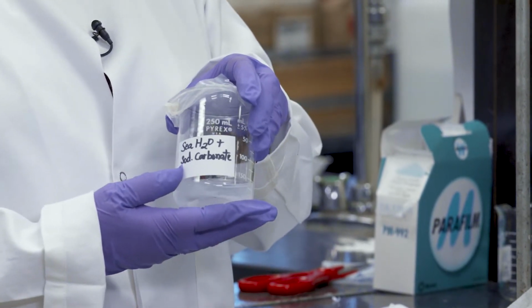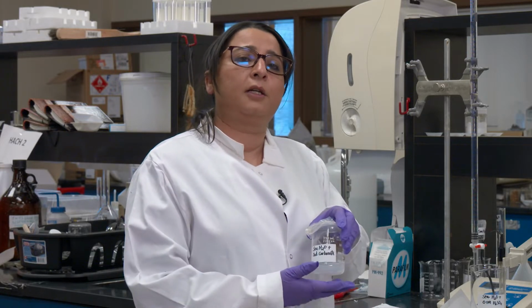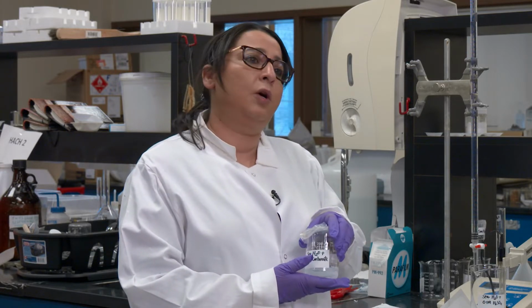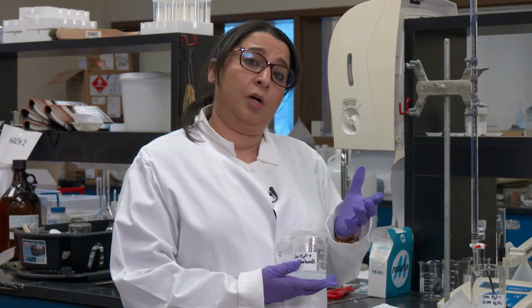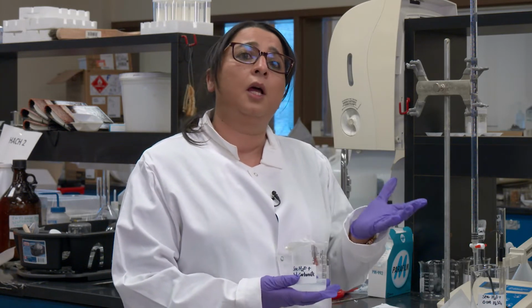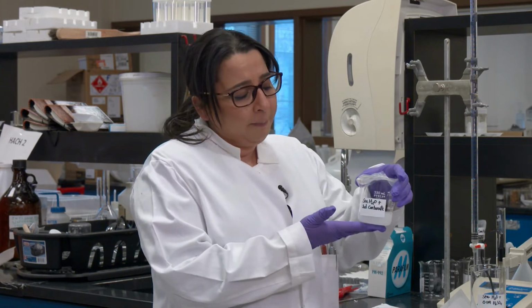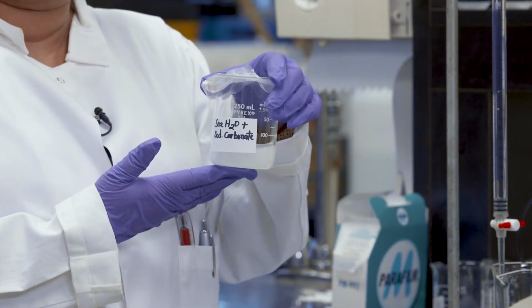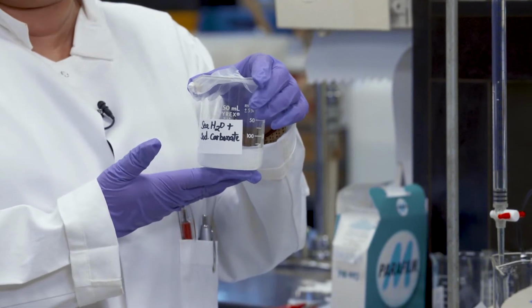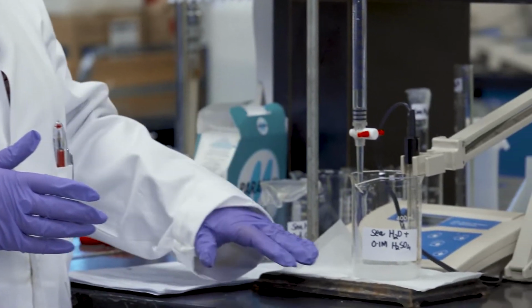I have added sodium carbonate to it just to add some buffer to the solution, because naturally occurring seawater has calcium carbonate. We can definitely use calcium carbonate for a lab experiment, but for us, I just added sodium carbonate. I have already prepared this one to show you that it's not clear anymore because it has carbonate, so it's a bit cloudy. The same solution is here in the experiment.